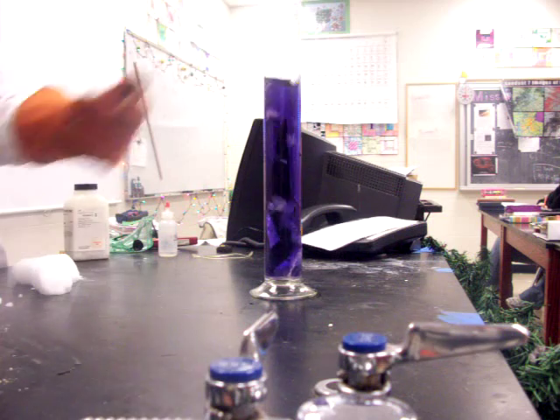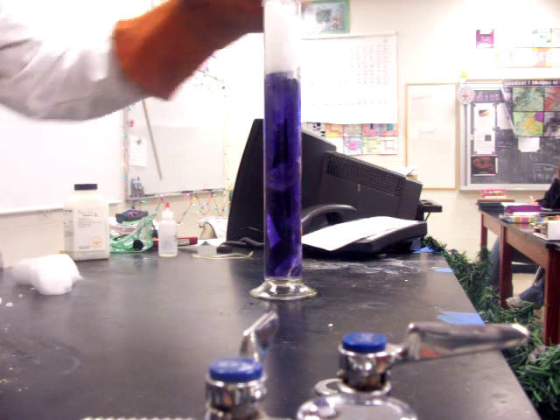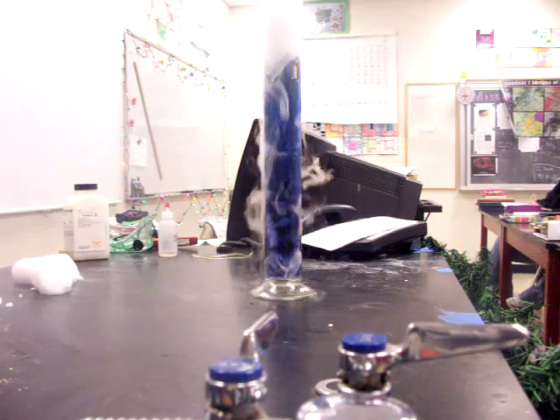To that, I'm going to add a couple chunks of dry ice, and that's going to carbonate the water and cause it to change colors.